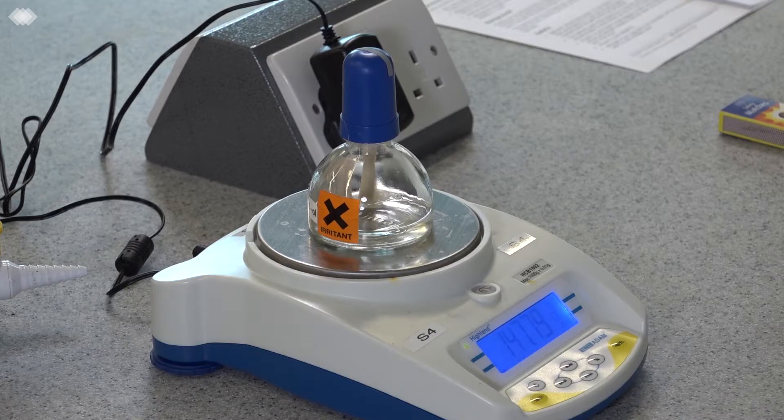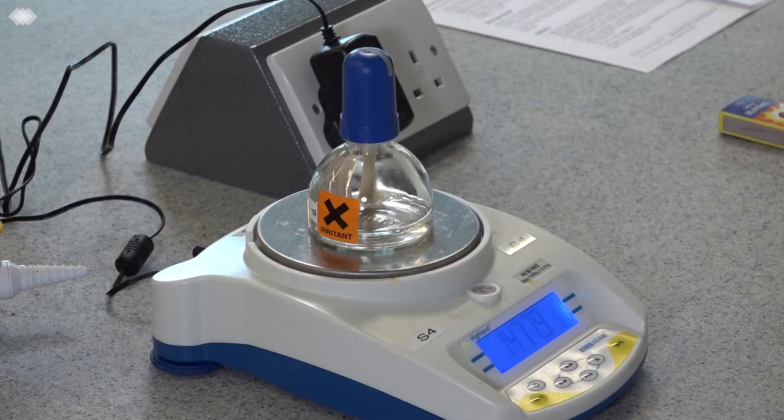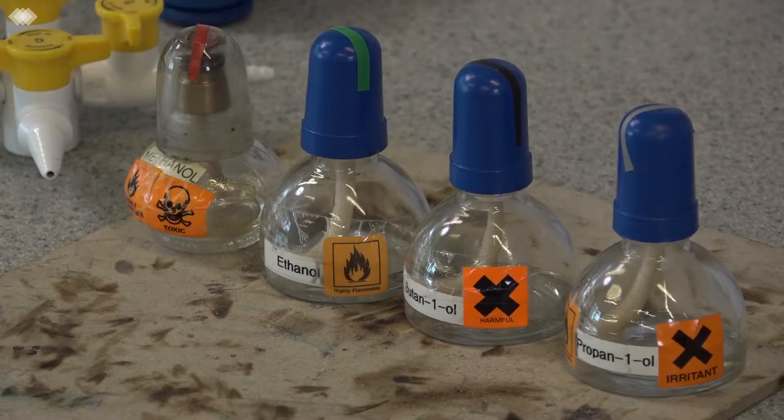Record the exact change in the temperature of the water in the calorimeter. You can now calculate the moles of fuel burned and the energy change of the water. Calculate the enthalpy change of combustion.